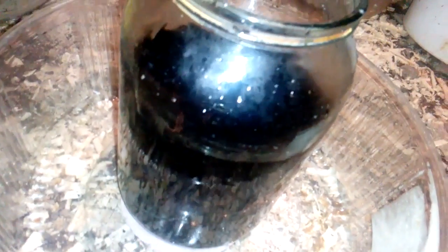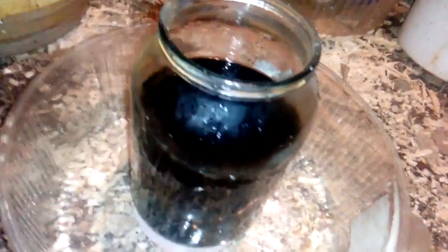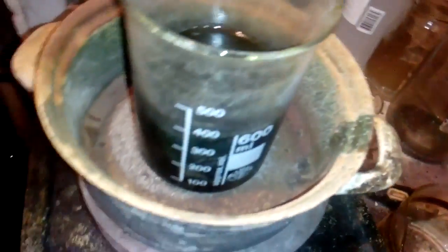Maybe they need a lot more, but poor man's Aqua Regia needs almost 2 liters. See that jar is not full. The jar is 2.5 liter, so we got here more than 400 milliliter, and we add HCl and nitric salt. So okay, we'll wait.